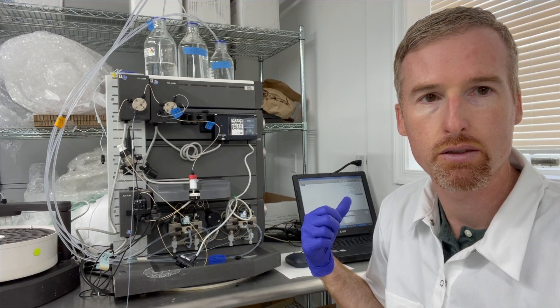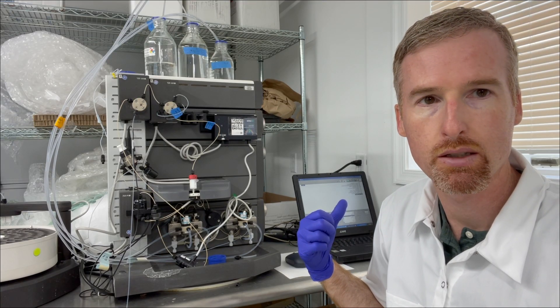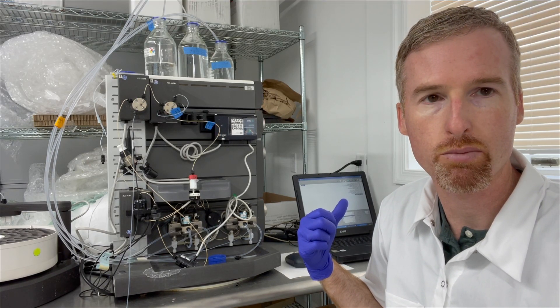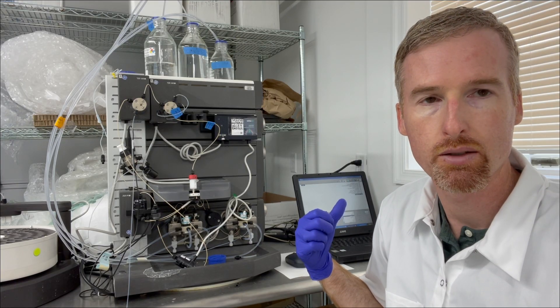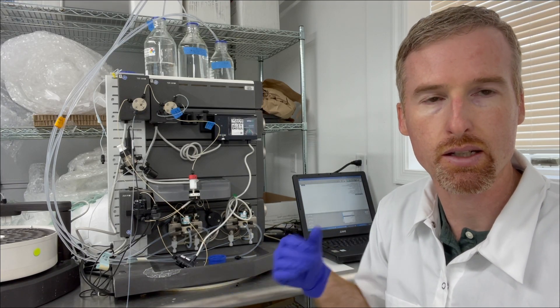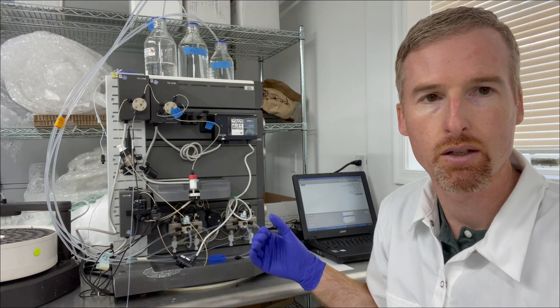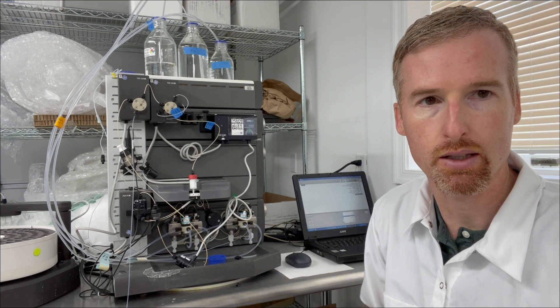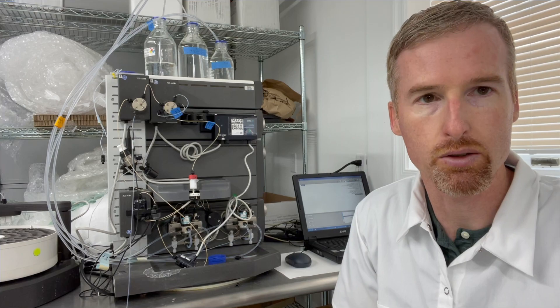And then I'm going to tell it to pump at 2.5 mils per minute for a total of about 15 or 20 mils, or until I see the conductivity of the solution coming out of my column equilibrate, and then I'll know that we're ready to load the protein.